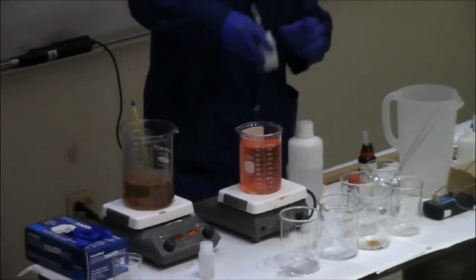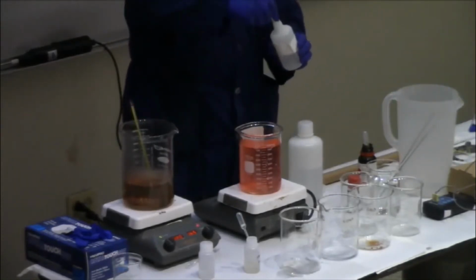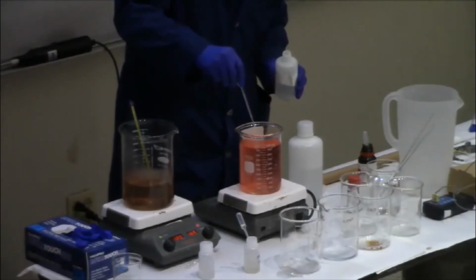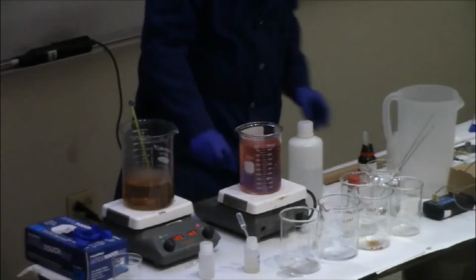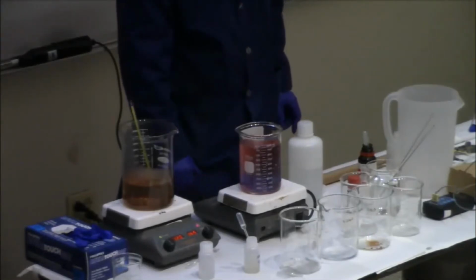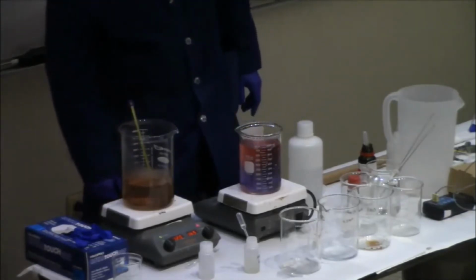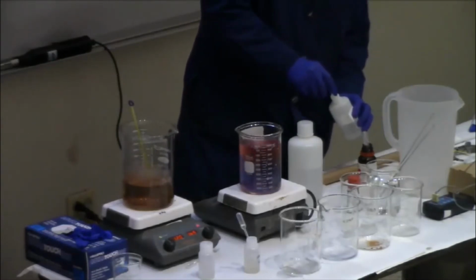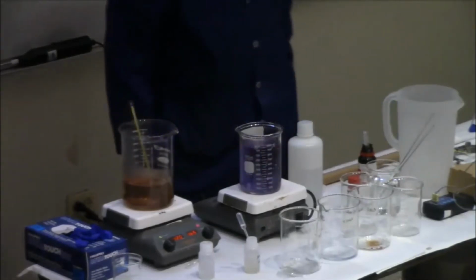Try that again. And with the magic spell, maybe it will be faster. Alright, let's turn it blue again. That blue?